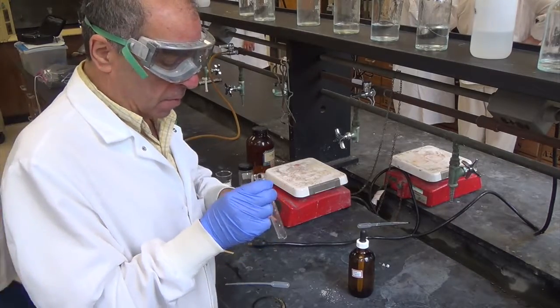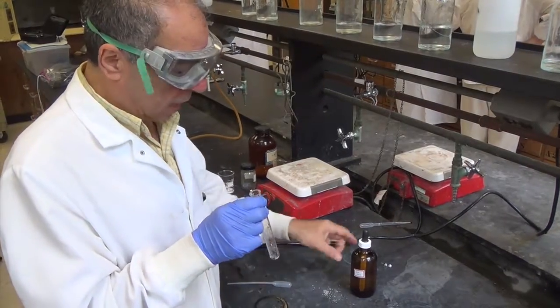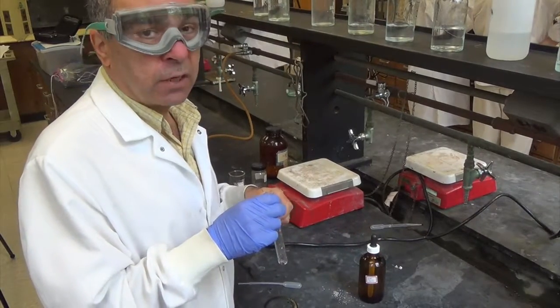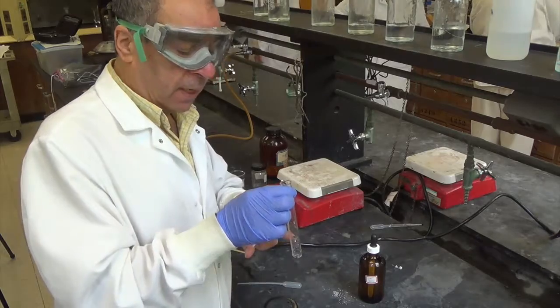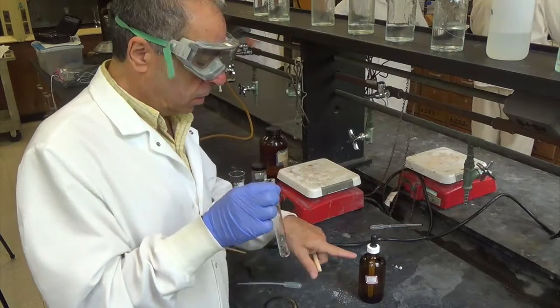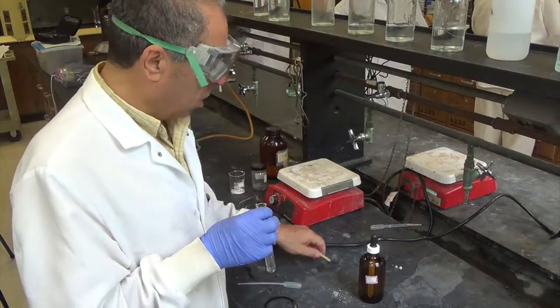The reaction between magnesium metal and hydrochloric acid, trying to find out the nature of the gas evolved. I have little pieces of magnesium metal in the test tube, and to that I'm going to add hydrochloric acid.